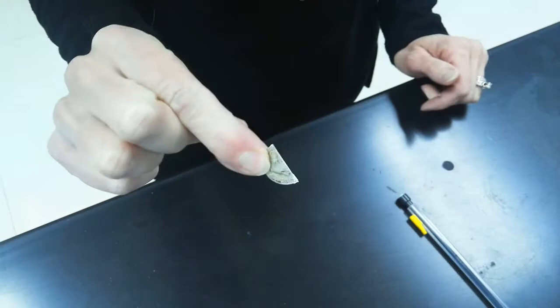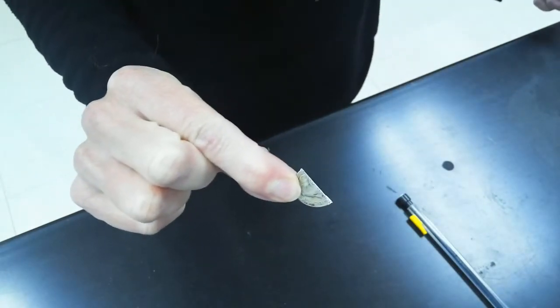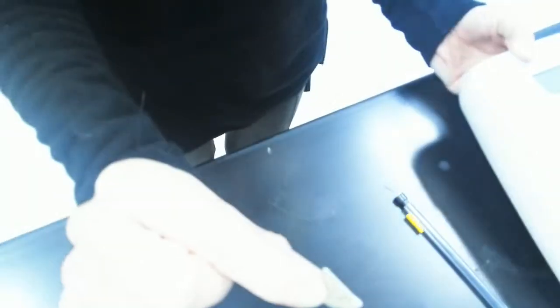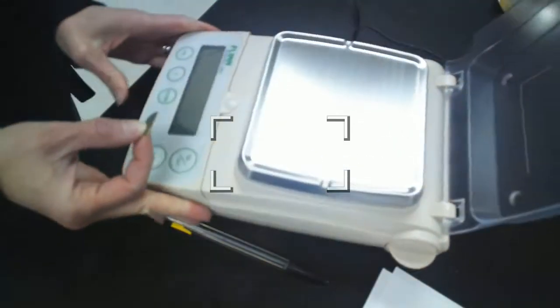Okay, so all we have to do is first take the mass of this guy, so we'll bring in the electronic balance so we can find its mass. And then we're just gonna put it in some nitric acid. So for today this should be pretty simple.